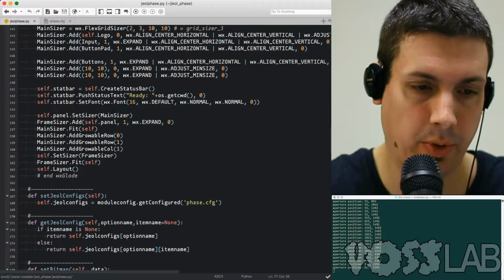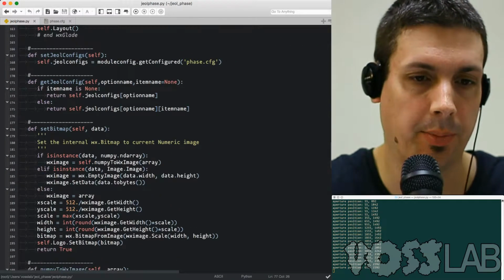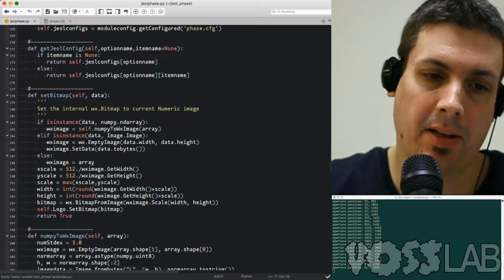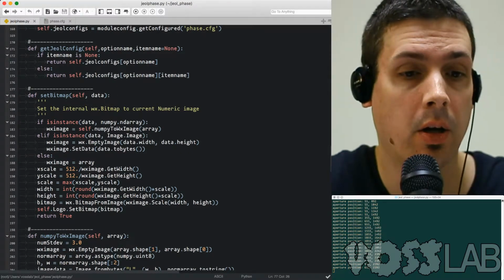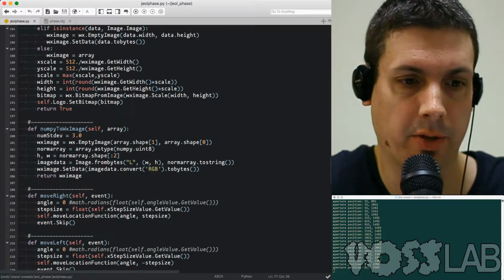I have the components that read the configuration file, and I'm actually not using that. I just kind of pull it up directly. Set the bitmap because we're using wxPython. Maybe not the best choice, but I know it best. And I'm converting from the Python Imaging Library, or so-called Pillow now, to set the image data. You can set it from NumPy too, but I'm not using that function.